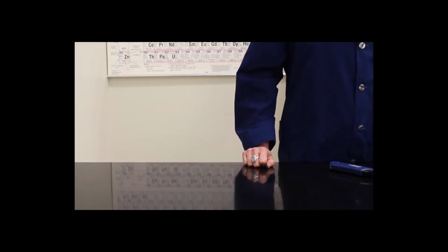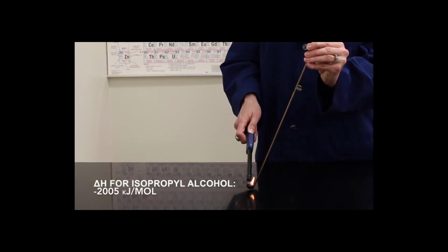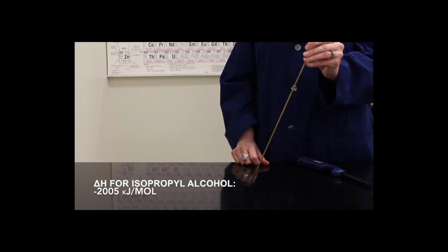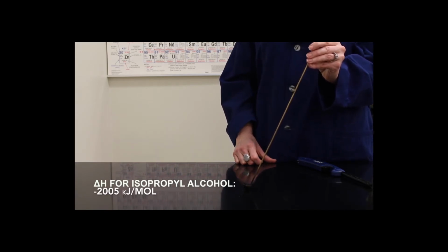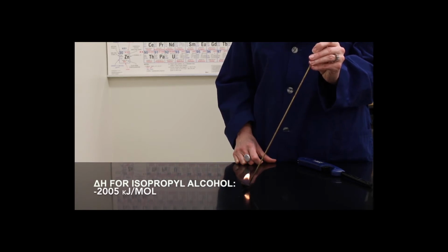We're now going to go to isopropyl alcohol. Isopropyl alcohol is slightly larger, as it has an extra carbon atom in the molecule. We're going to light the substance and look at the flame. Since this molecule is similar in size to ethanol, the flame is going to also be similar. It'll be relatively small, and that's because it has a similar heat of reaction.